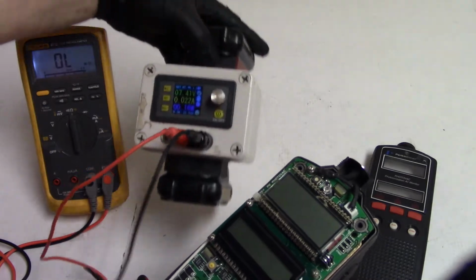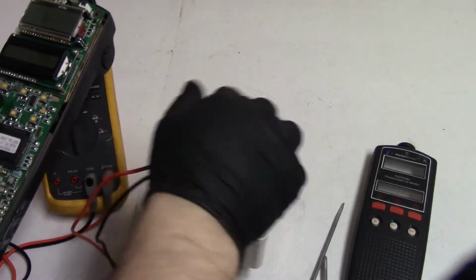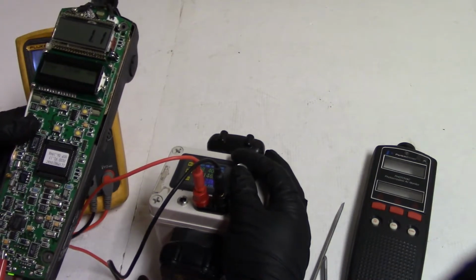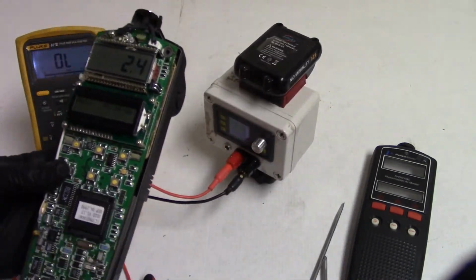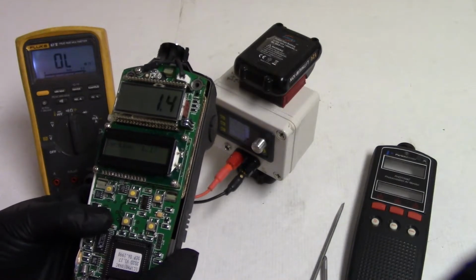Is that not enough power? Yeah, not enough power. So maybe it needs a little more voltage. Let's go to 8 volts. Oh yeah, there it goes. So it's getting 2.6. Alright. Come on, off.